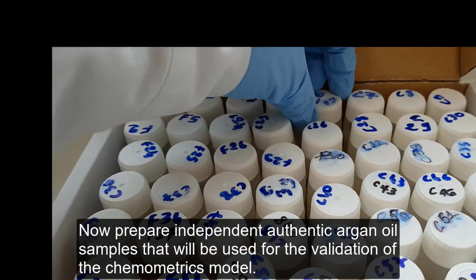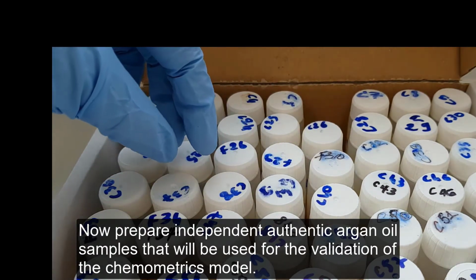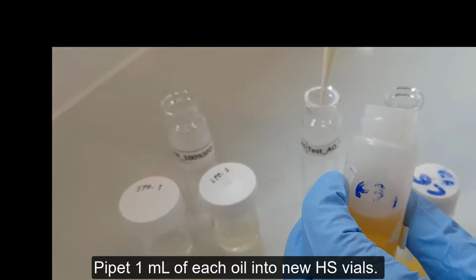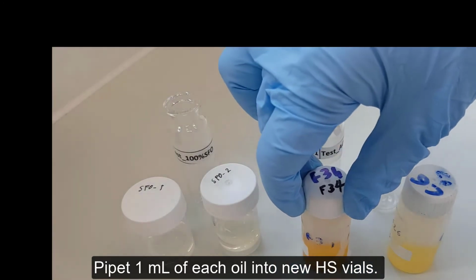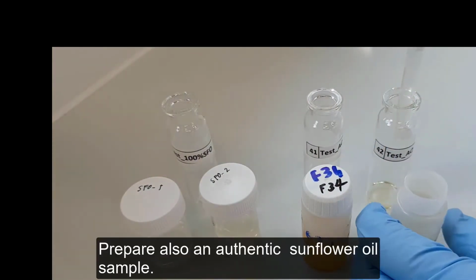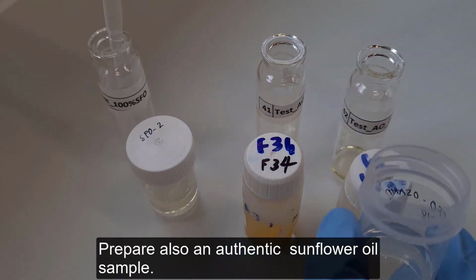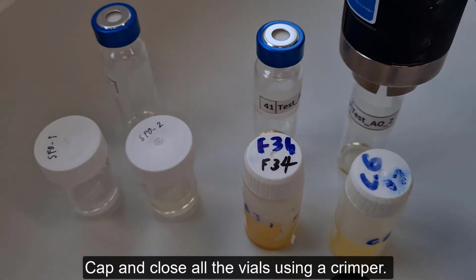Now, prepare independent authentic argan oil samples that will be used for the validation of the chemometrics model. Select at random any 2 authentic argan oils that have not been used in the previous steps. Pipette 1 ml of each oil into new headspace vials. Prepare also an authentic sunflower oil sample. Cap and close all the vials using a crimper.